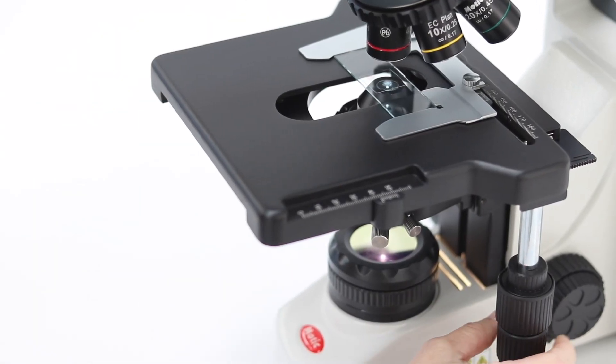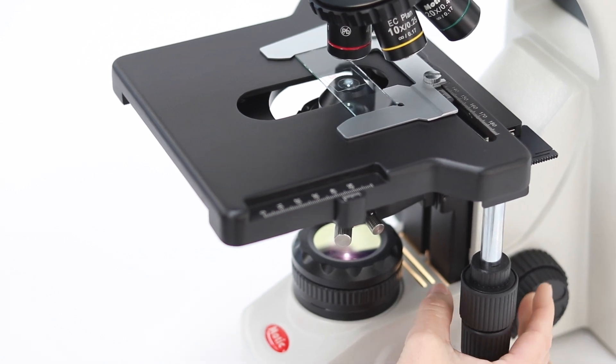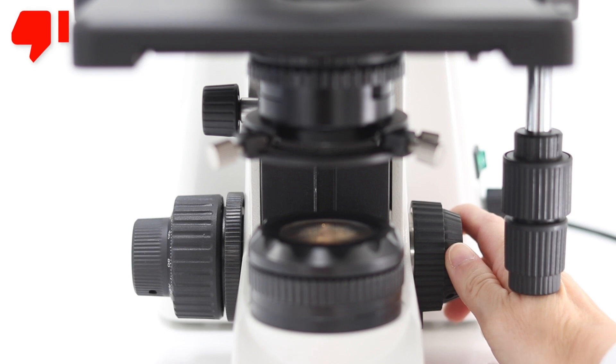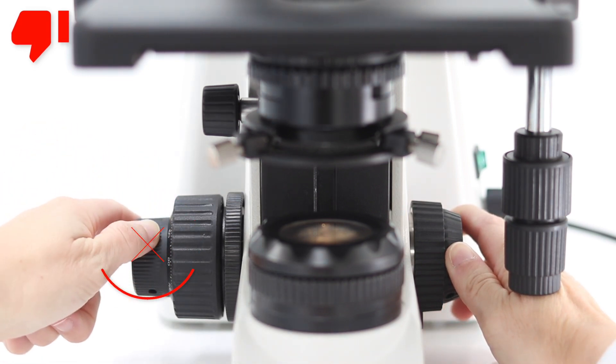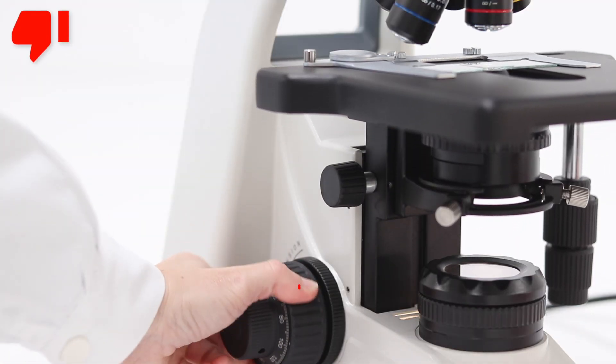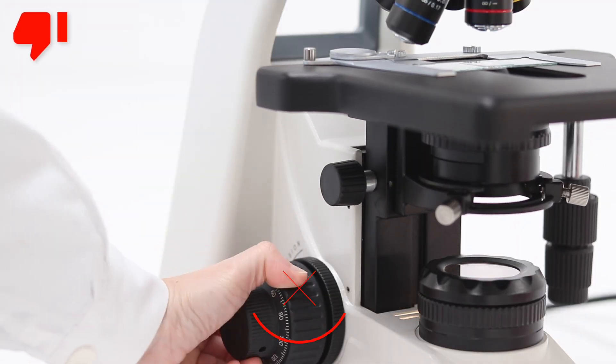When using the microscope, do not force any of the mechanical components such as the focusing knobs. Do not rotate either the left or the right knob while holding the other. Do not exceed the limit of the coarse and fine focusing knobs whilst rotating them.